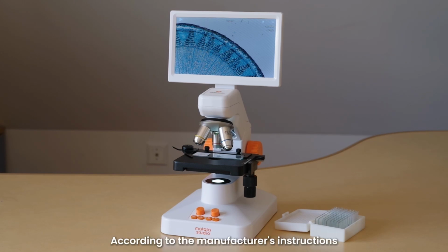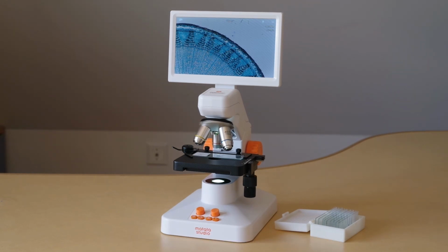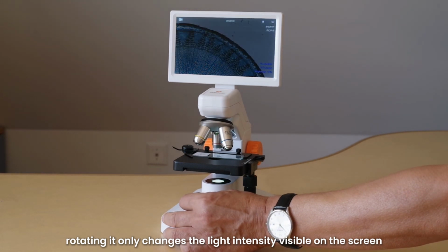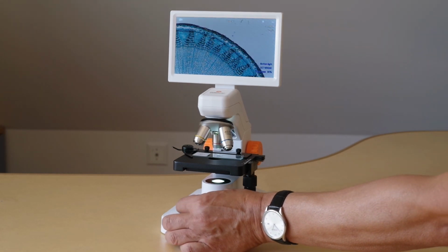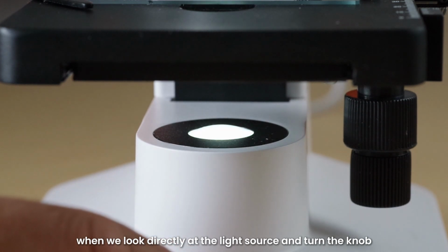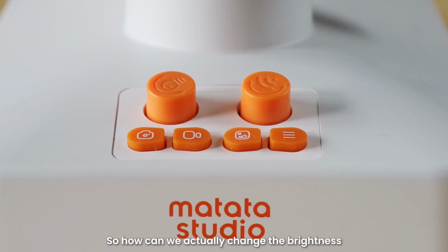According to the manufacturer's instructions, the round button on the left side is used to change the intensity of the light source. But rotating it only changes the light intensity visible on the screen for a fraction of a second, after which the screen brightness returns to its previous state. But when we look directly at the light source and turn the knob, we can clearly see changes in its brightness. So, how can we actually change the brightness of the image displayed on the monitor?